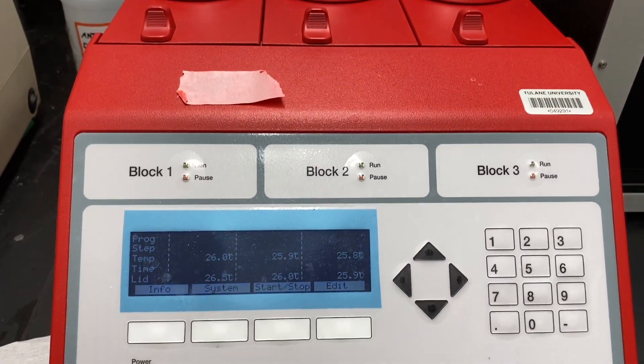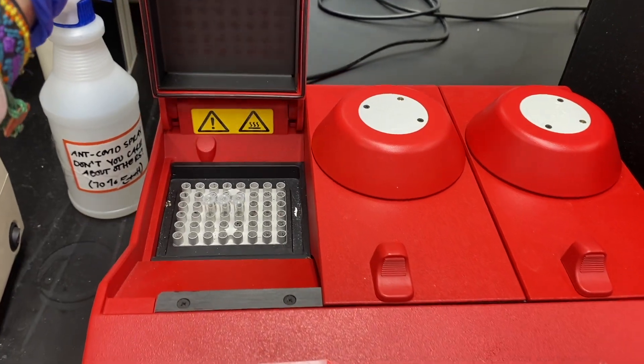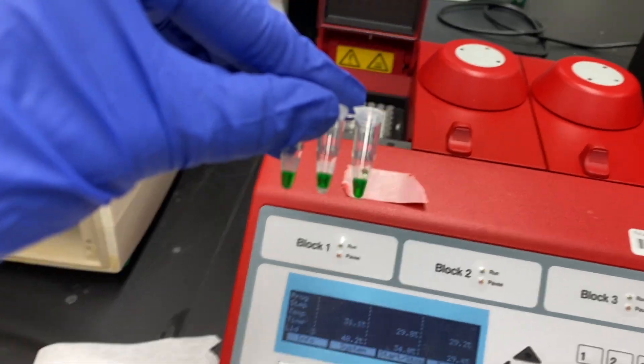After about 2 hours, we now have an amplified portion of DNA, meaning that that needle in a haystack is starting to look more like some hay in a stack of needles.